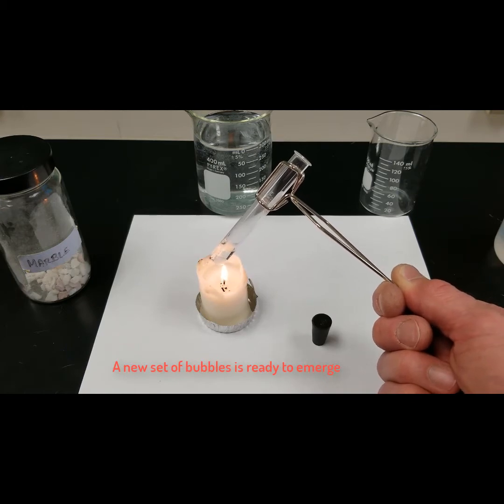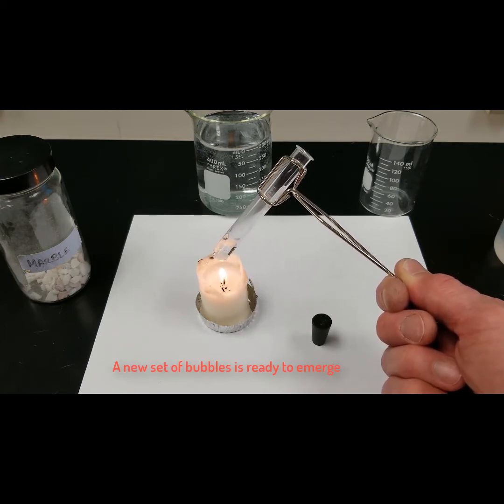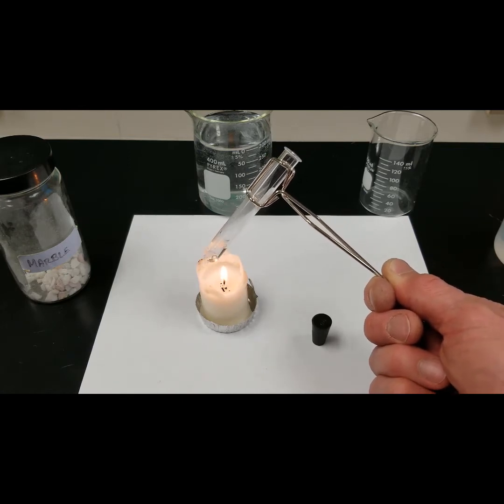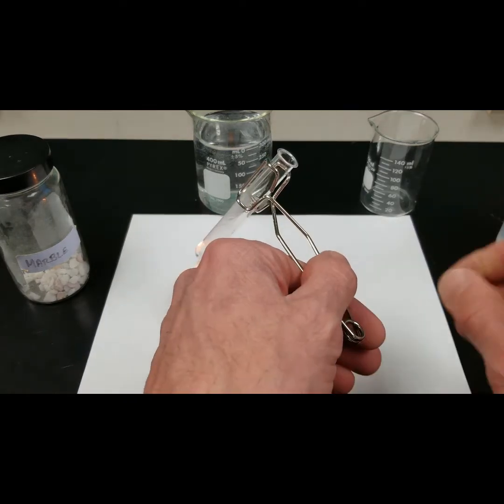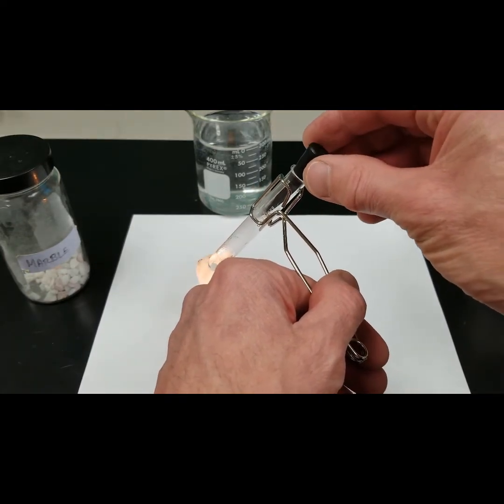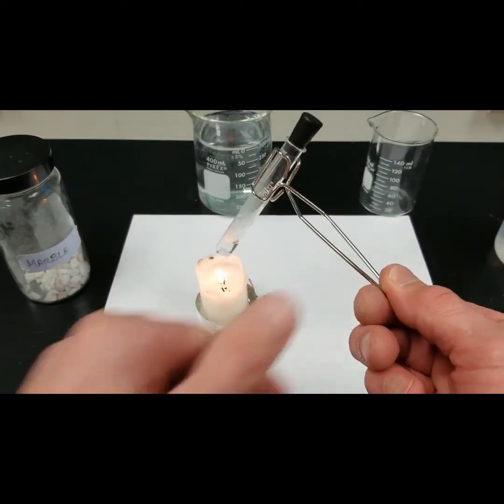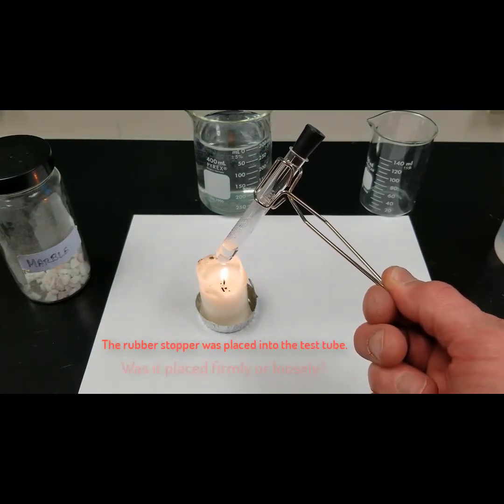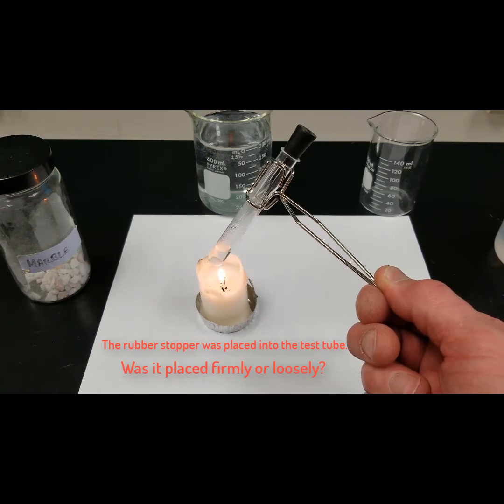A new set of bubbles is ready to emerge. The rubber stopper was placed into the test tube. Was it placed firmly or loosely?